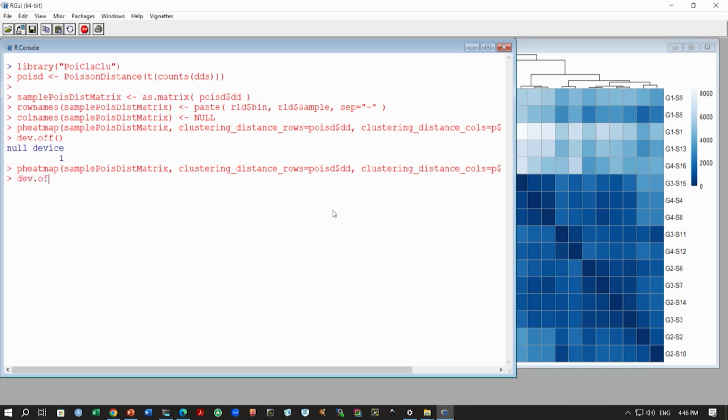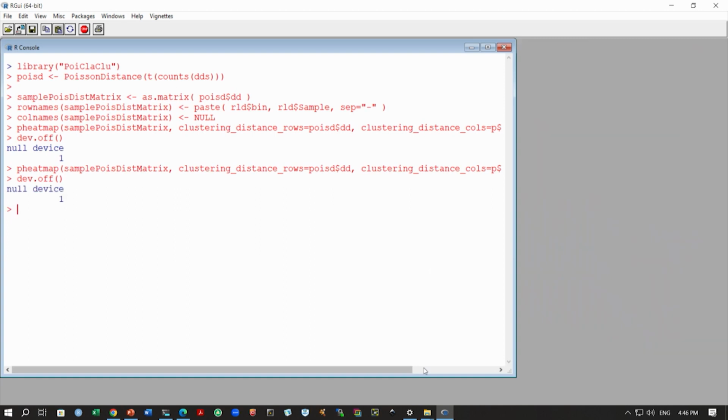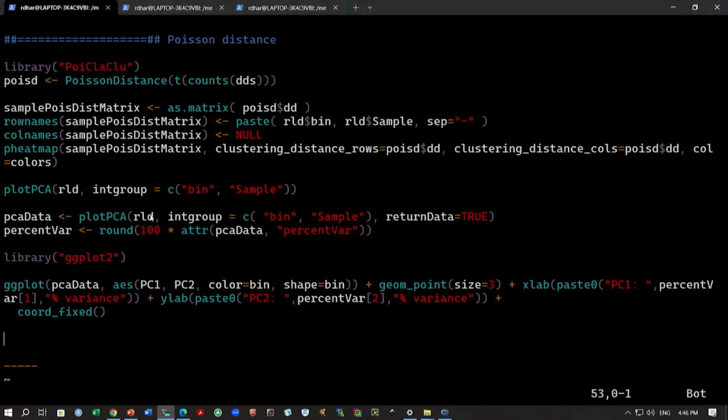So, what we can do now, we can go into the PCA, right. So, we can generate this PCA plot. To do that, we again have this RLD data, this R-log transformation that we did, and we can use this function called plotPCA. So, this will generate this PCA plot from the data, and it will give these PCA percentages as well.